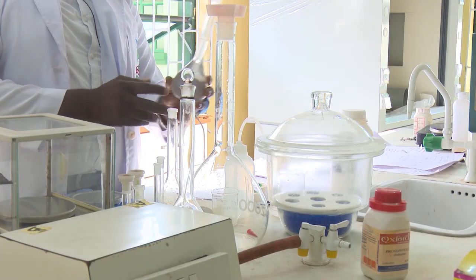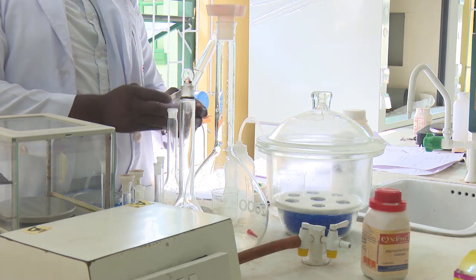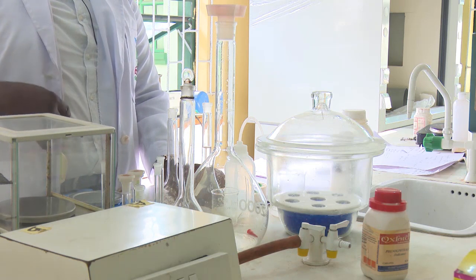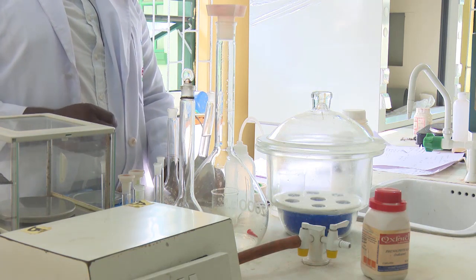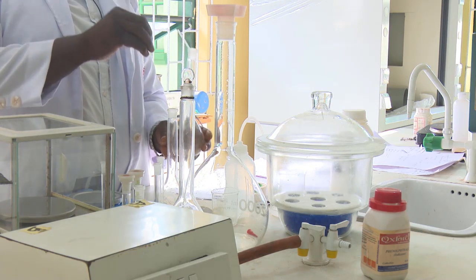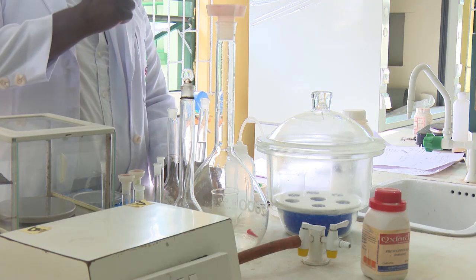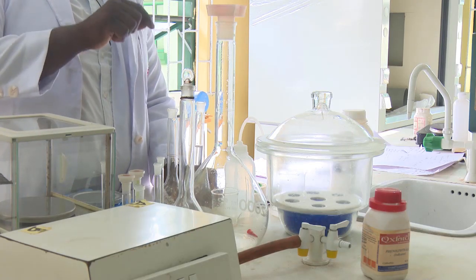Thank you. We are coming back to our preparation, having done the initial one, which is 1 molar. Now we need to prepare a lower concentration. How do we do that? We are going to use a formula called the serial dilution formula, as you were told in your class initially, and that is M1V1 = M2V2. Your M1 is the concentration of your initial solution. Your V1 is the volume we need to calculate, because that is the volume we need to take to prepare the subsequent dilutions, whereas your M2 is the concentration we want to prepare now, and your V2 is the volume we want to prepare it to.